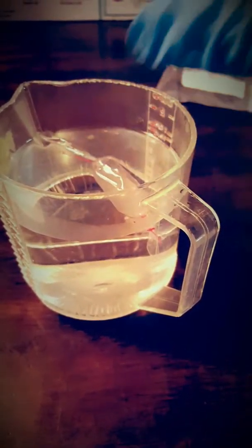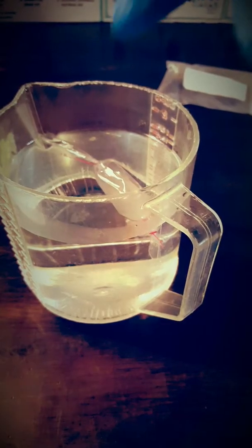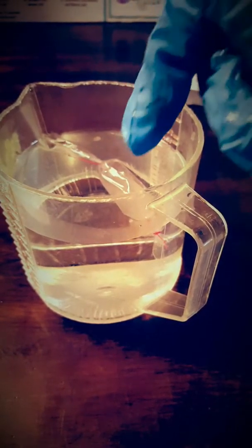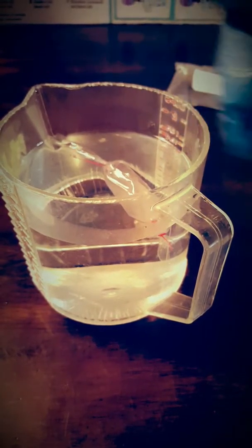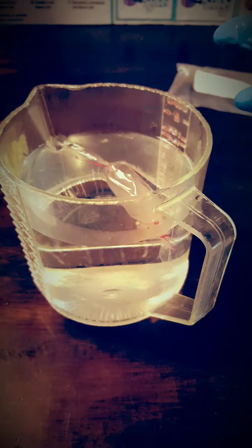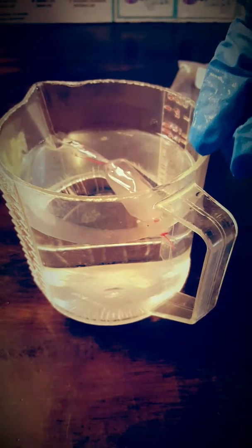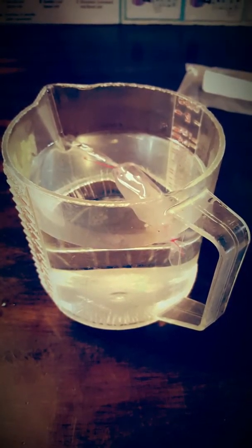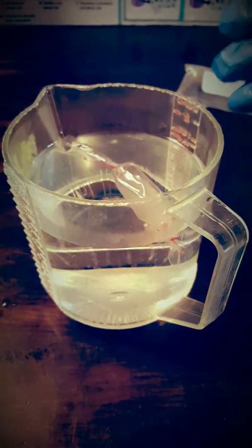And the other two solutions, which are just going to be bags with water, one of them is going to be put in the same kind of beaker with just water. That's going to be an isotonic environment, so that should stay the same weight. And the last little bag with just water is going to be put into a beaker that is 20% glucose solution. So that one should lose weight as the water is going to move out of the bag into the solution to bring the concentration down.